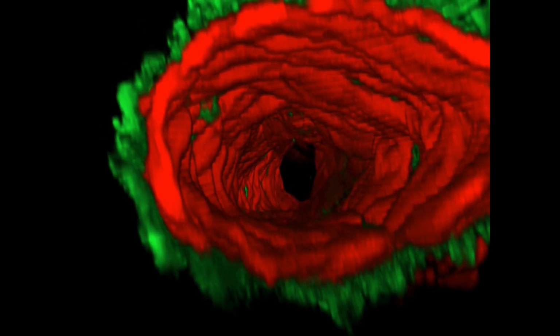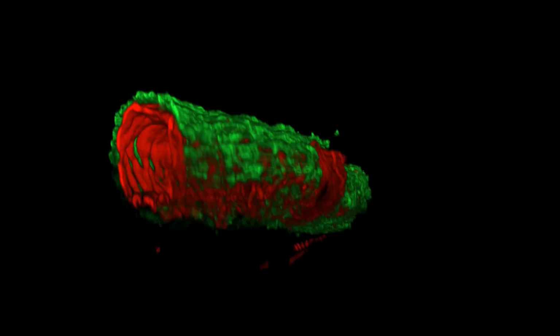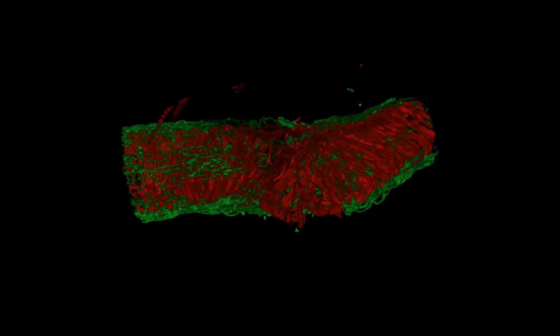You can also create movies of these actions, thus allowing you to share this 3D perspective with your colleagues as you rotate, zoom, and fly through the rendered object. Even more critically, it allows you to combine your quantitative analysis with 3D rendering to get a better idea of what's happening in a 3D space, which is often more relevant to a biological sample than a 2D perspective.